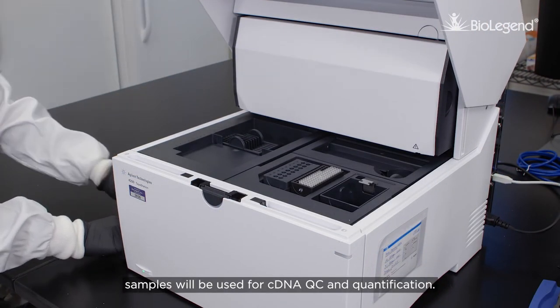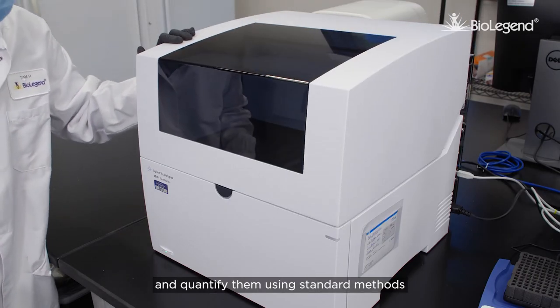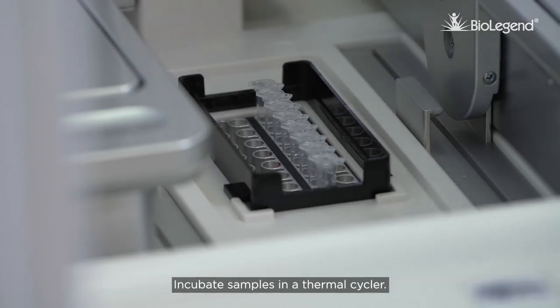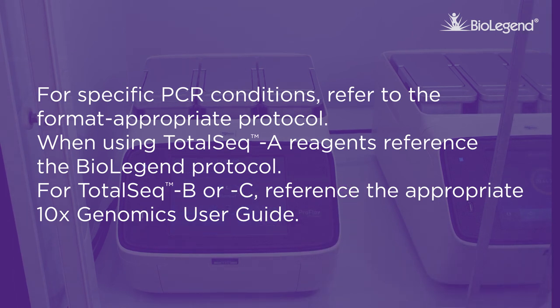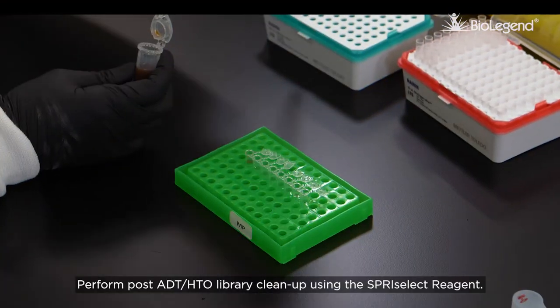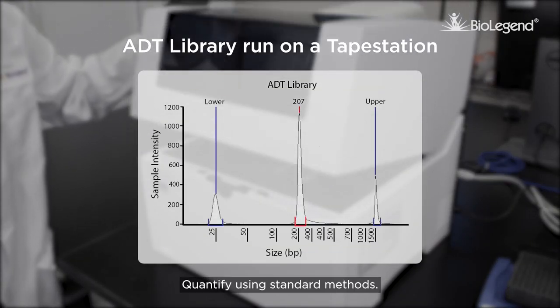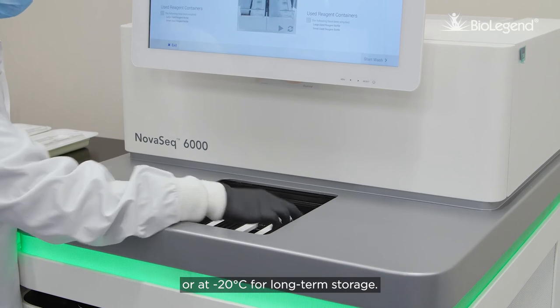After pellet cleanup, samples will be used for cDNA QC and quantification. Run each sample on a bioanalyzer or tape station to check the quality of the libraries and quantify them using standard methods. Prepare mRNA libraries for sequencing by following the 10x Genomics User Guide. To generate the cell surface protein library, prepare the sample PCR mix and incubate samples in a thermal cycler. For specific PCR conditions, refer to the format-appropriate protocol — when using TotalSeq-A reagents, reference the BioLegend protocol; for TotalSeq-B or C, reference the appropriate 10x Genomics User Guide. Perform post ADT-HTO library cleanup using SPRI Select Reagent. Run each sample on a tape station to check the quality of the ADT library and quantify using standard methods. Store libraries at 4 degrees Celsius for up to 72 hours or at negative 20 degrees Celsius for long-term storage.